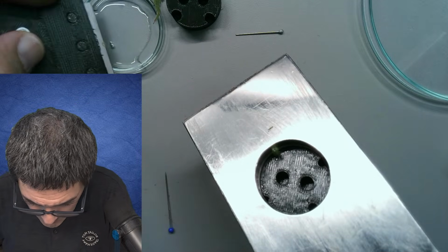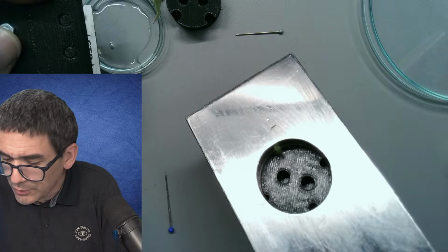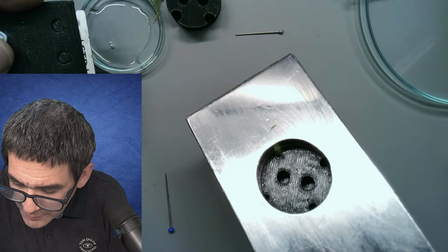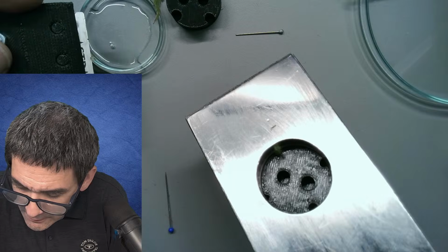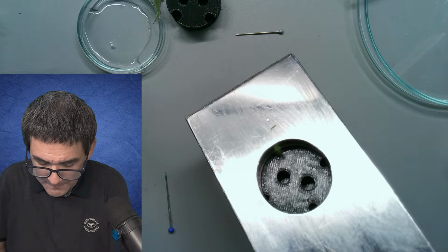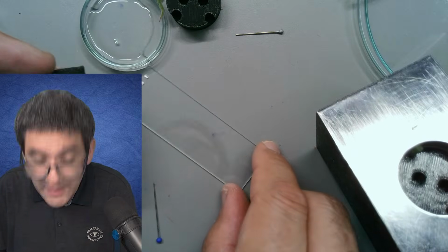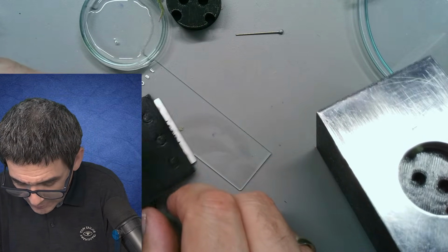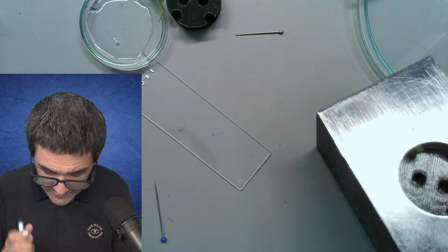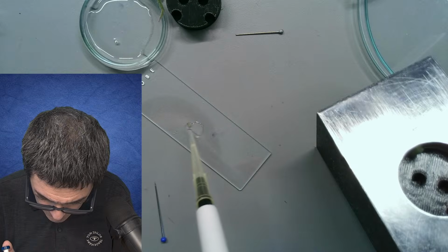Quickly into the water. You know what? No, I'm not going to put it into the water down here. I'm going to actually put it directly on a microscope slide. I think we're just going to save the little intermediate step here. So let's do it just like last week. I'm just going to save this intermediate step and let's add the water directly. And let's put this in here.